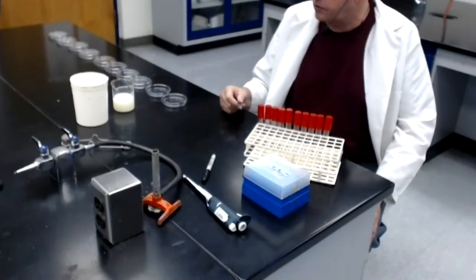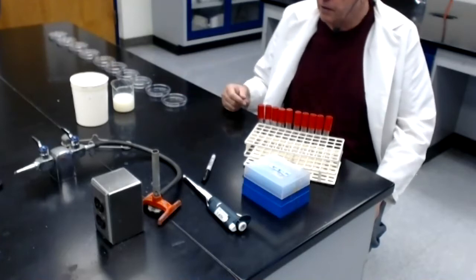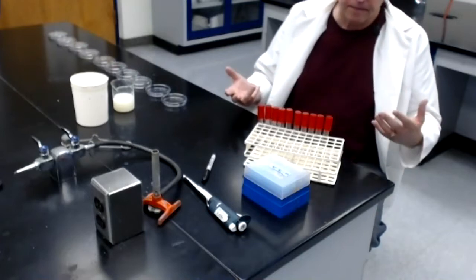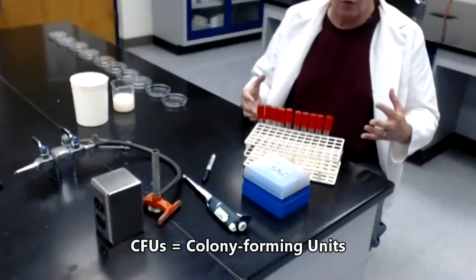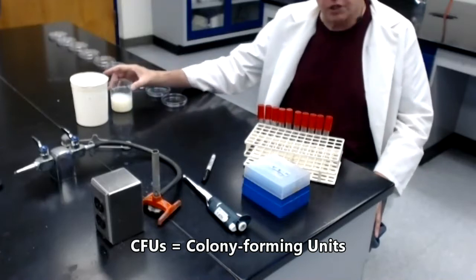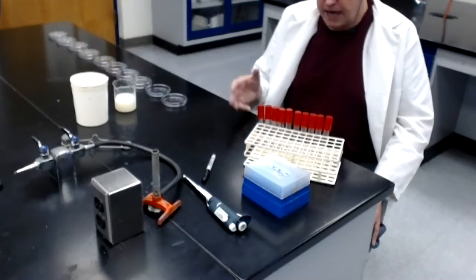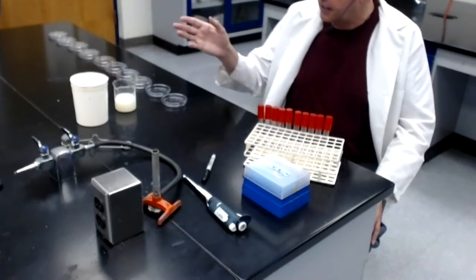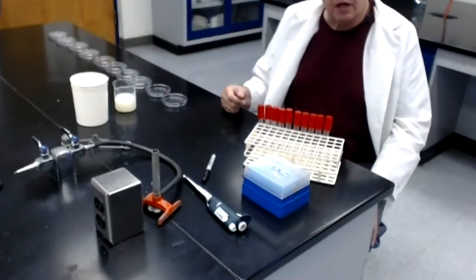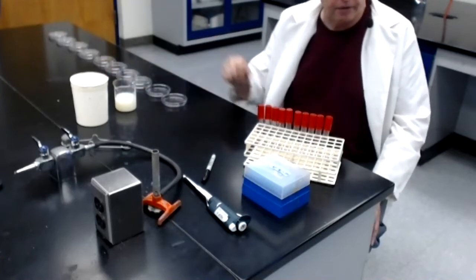Oftentimes, when we want to count the number of bacteria in a sample like milk, we eventually want to come up with a number of bacteria, usually referred to as the number of colony-forming units, or CFUs, per milliliter of the original sample. In this case, the original sample is milk. So the question becomes, how do we do that? How do we take the contaminated sample and eventually determine the number of colony-forming units that are present in every milliliter of the original milk sample?